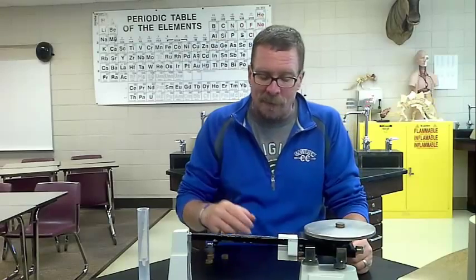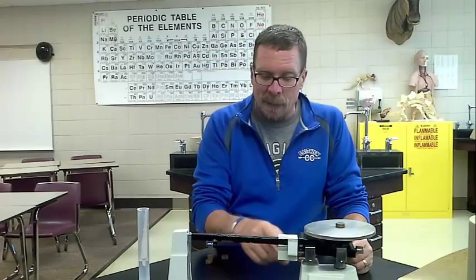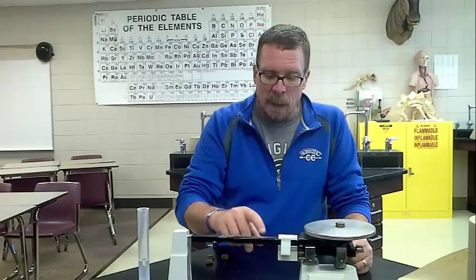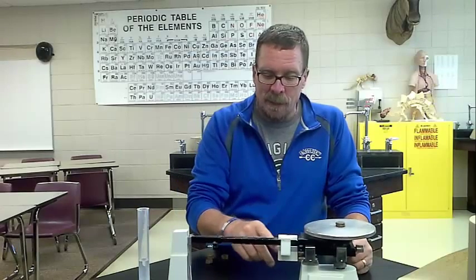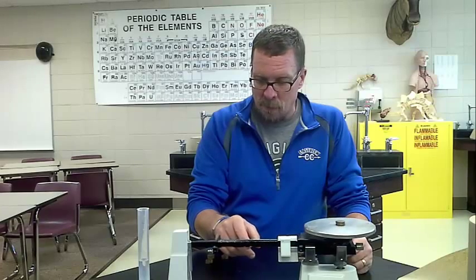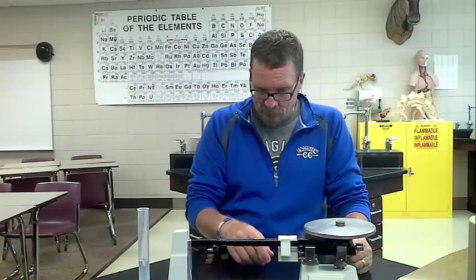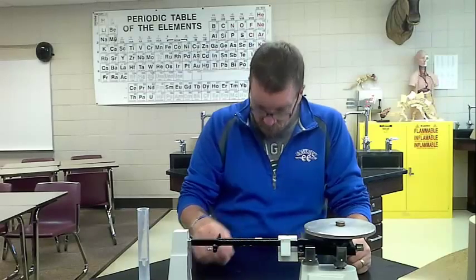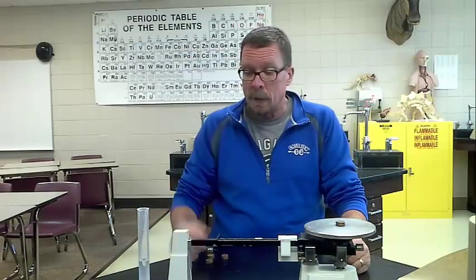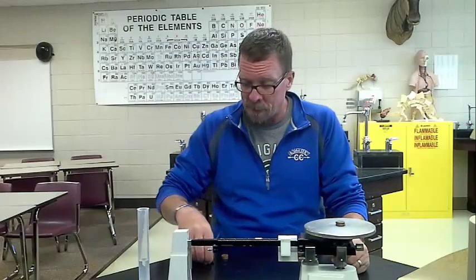I'm just going to put 5 pennies on there, and I am going to get an accurate measurement of what the mass of 5 pennies is. We are close here, and that is roughly 15.12, yeah, I'll say 15.12 grams.